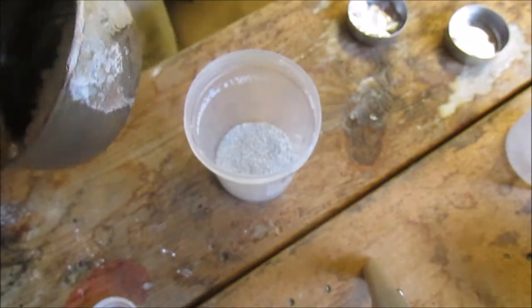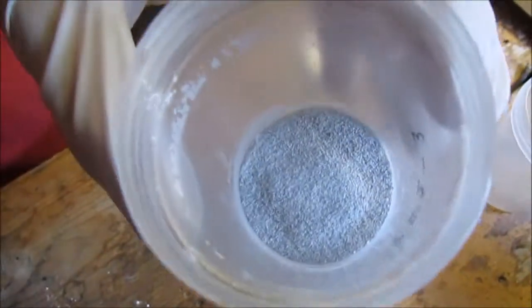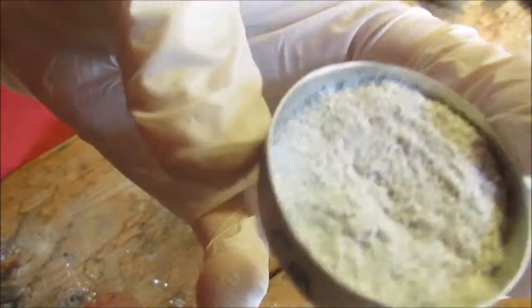Now I've got some calcium hydroxide, so I'm going to mix that in with magnesium. There we go. I've got them thoroughly mixed. Now I'll pour them in their little pan. There we go. And I labeled them so I know which one's which.